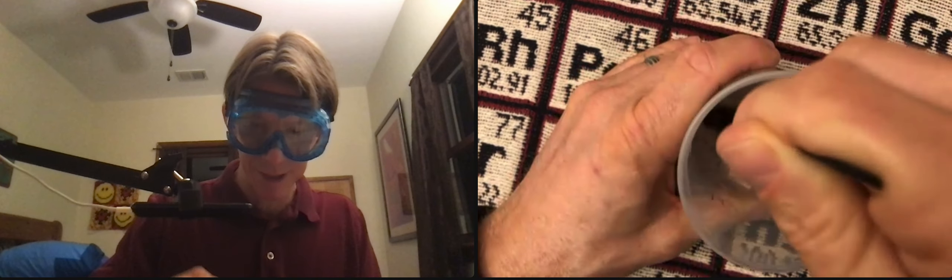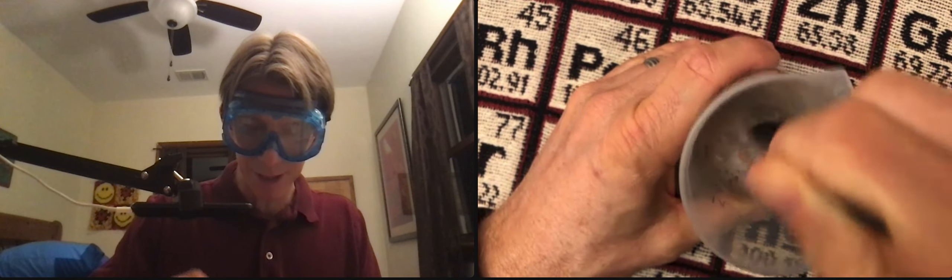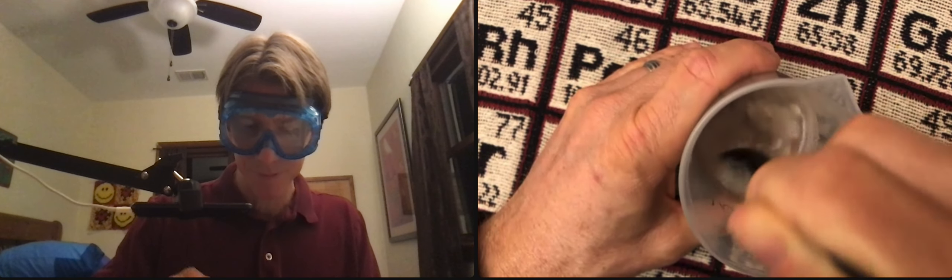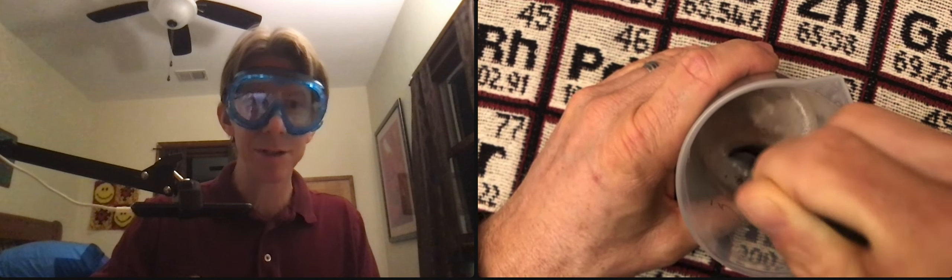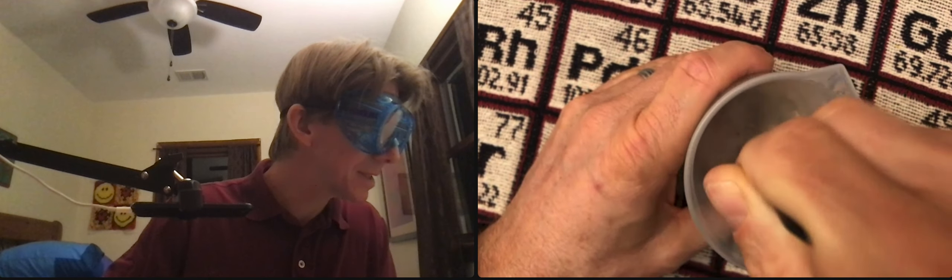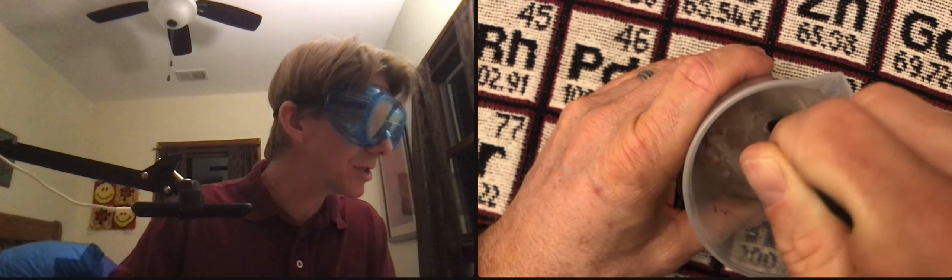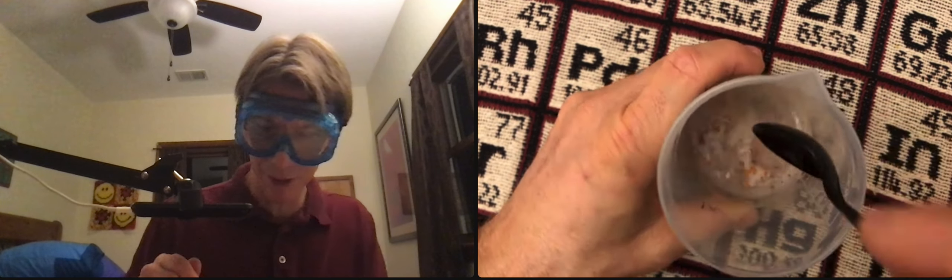I've still got lots of bubbles, still mixing it up. I'm going to do this for five minutes, I think it says. Take a picture of your eggshell-vinegar mixture within the first few minutes - it should be bubbling.